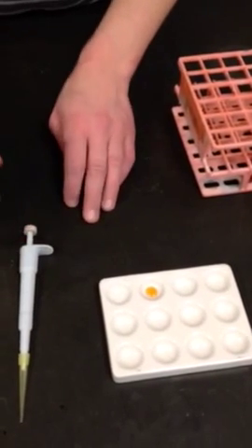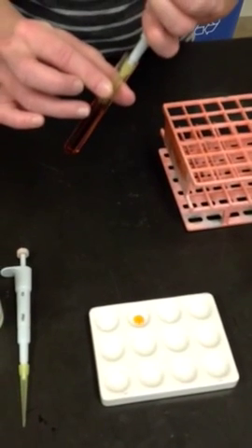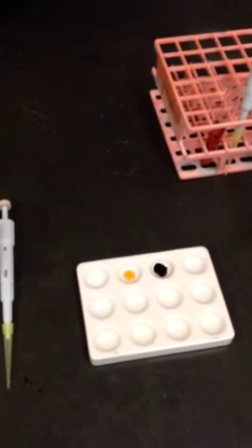Now we're going to try to put starch together with iodine and see what happens when they are in contact. So we have our starch, of course clear as it was in the first well, and our iodine. And as you can see, it turns really dark blue. We could almost call it black. So here we have a positive reaction between starch and iodine. Iodine is an indicator for starch, so when it changes color, we can tell there's starch.